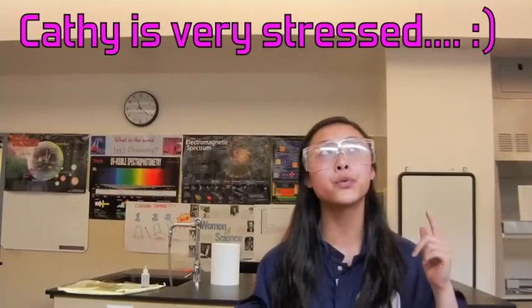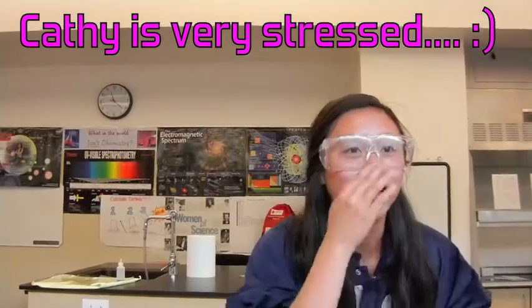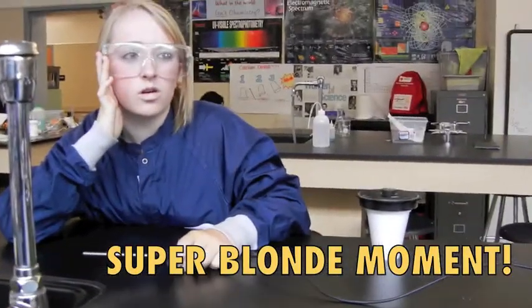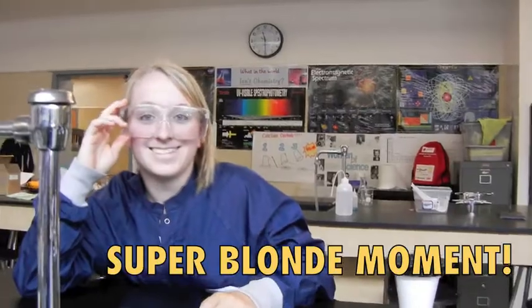For the first two, I'm sorry, I know we cut that out. Wait, do we wash with distilled water or this one? Do you want me to restart?